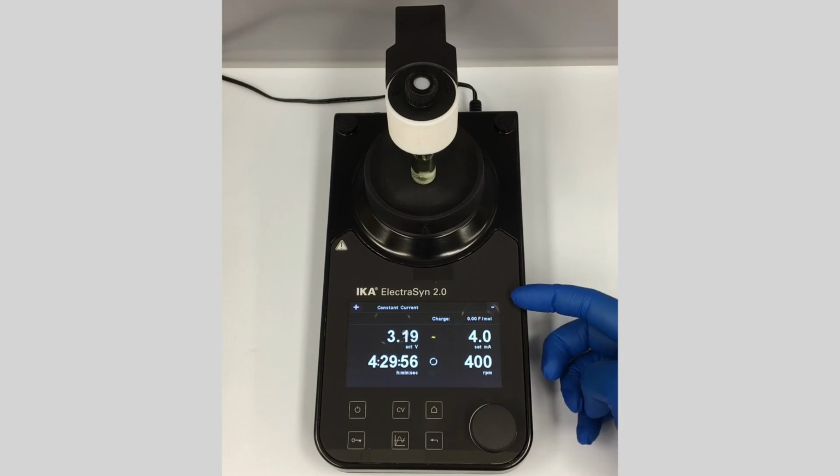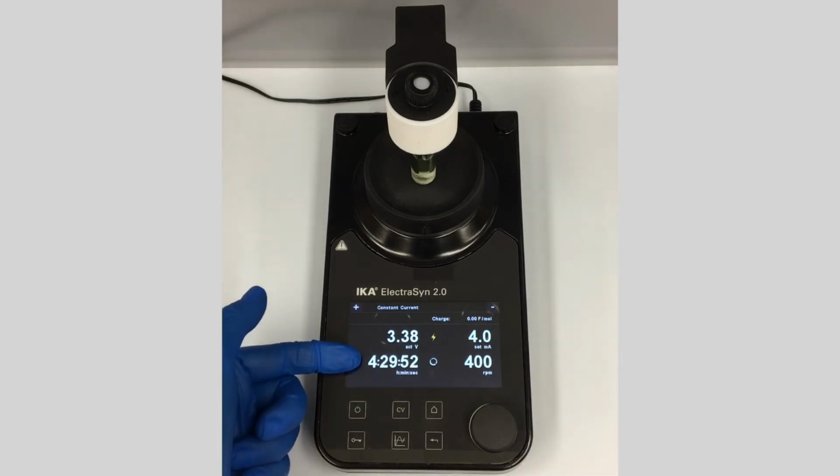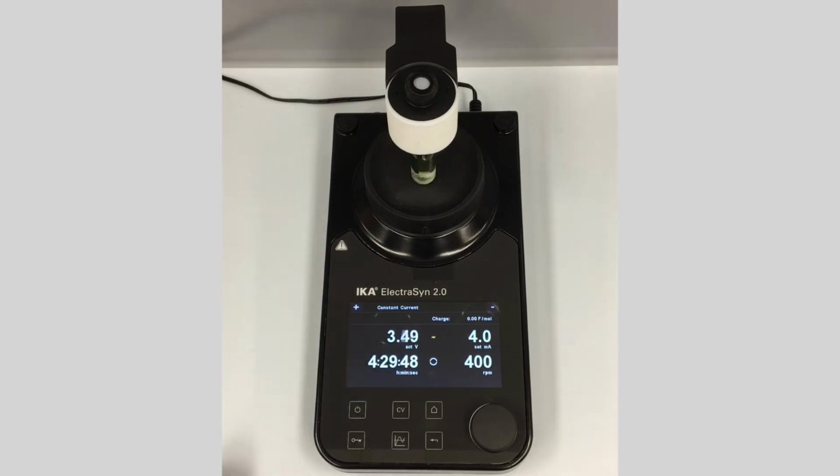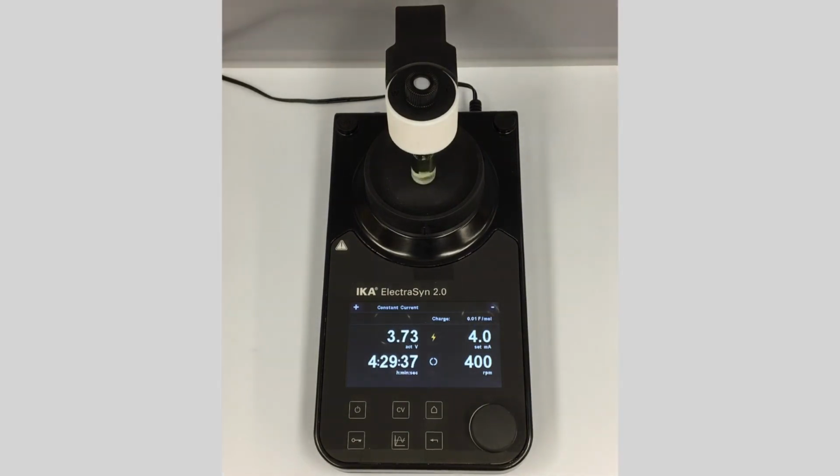And so here we see a couple things that are different from when we ran this using assist mode. We have a counter here, and this shows us how much time is remaining based on that 4 hours and 30 minutes we set. We also have the charge up here, and based on the number of millimoles that I put in for this reaction, this is going to tell us the number of Faradays per mole that have passed through the reaction as it progresses. That can be helpful to adjust your stoichiometry and to know maybe when reactions should be complete and what's going on in your reaction.